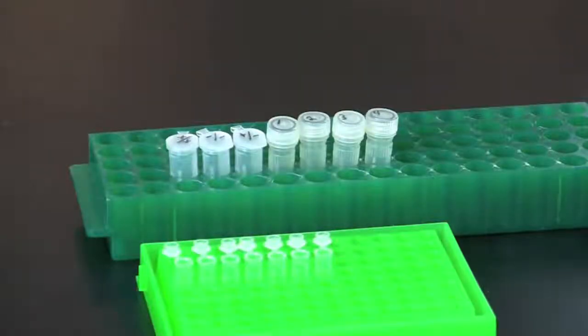This is a good stop point for this protocol, depending upon your laboratory schedule. The DNA in the screw cap tubes can be stored at 4 degrees Celsius for up to a month. Do not freeze the samples.